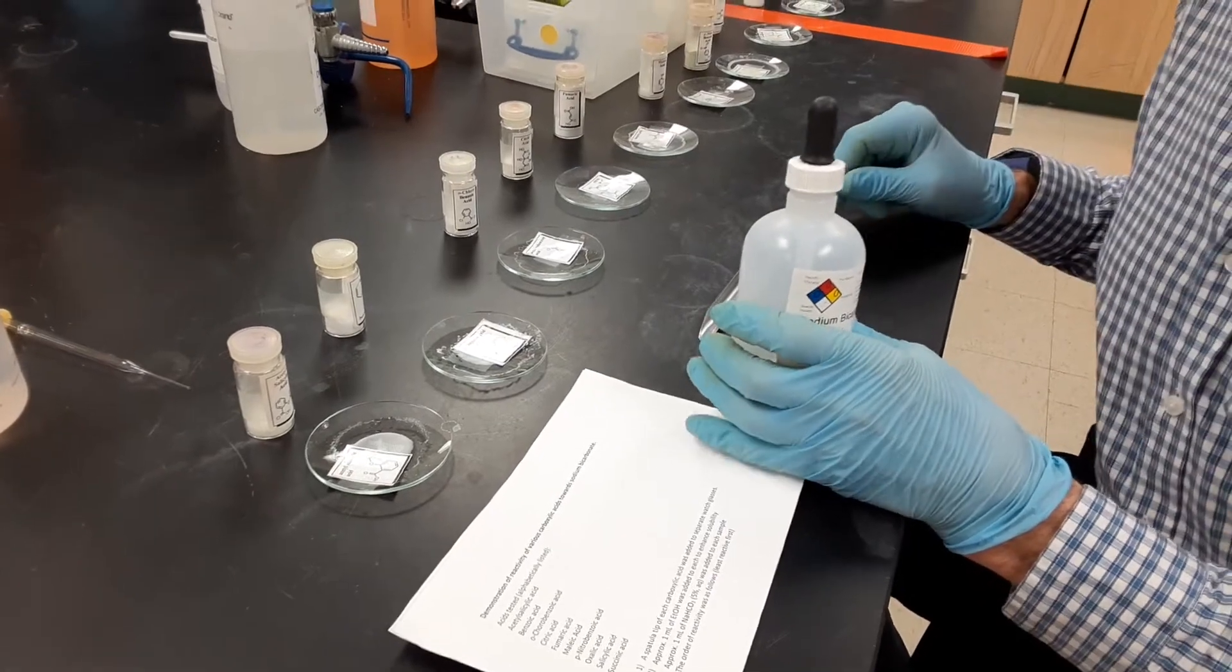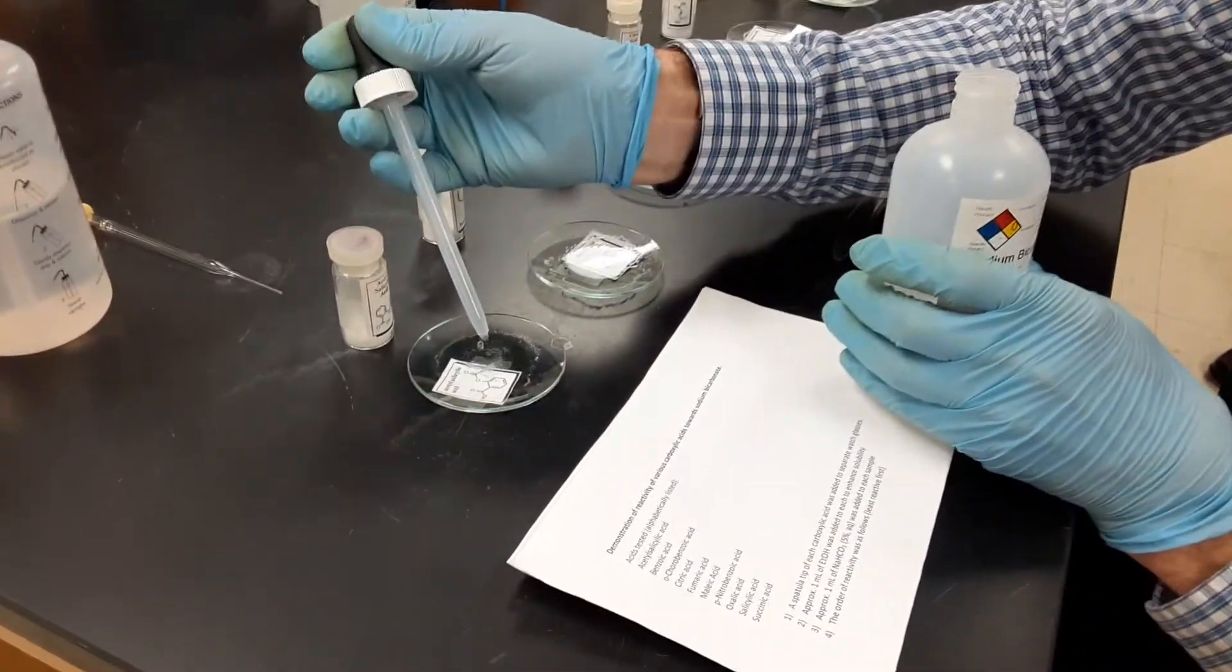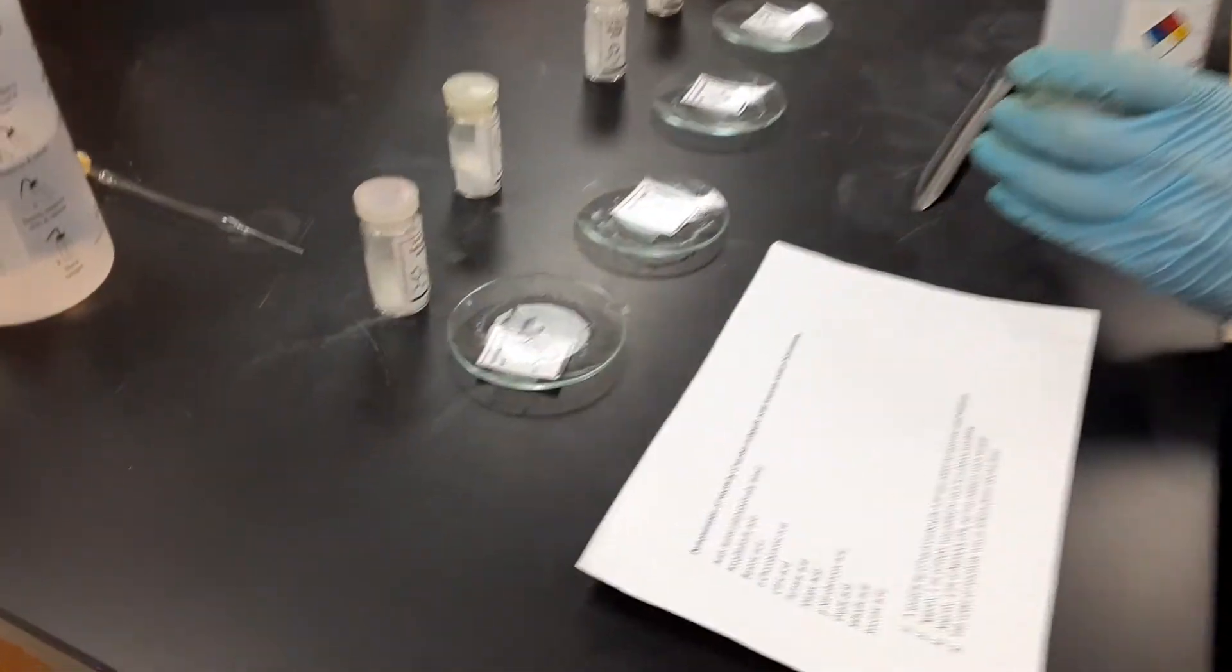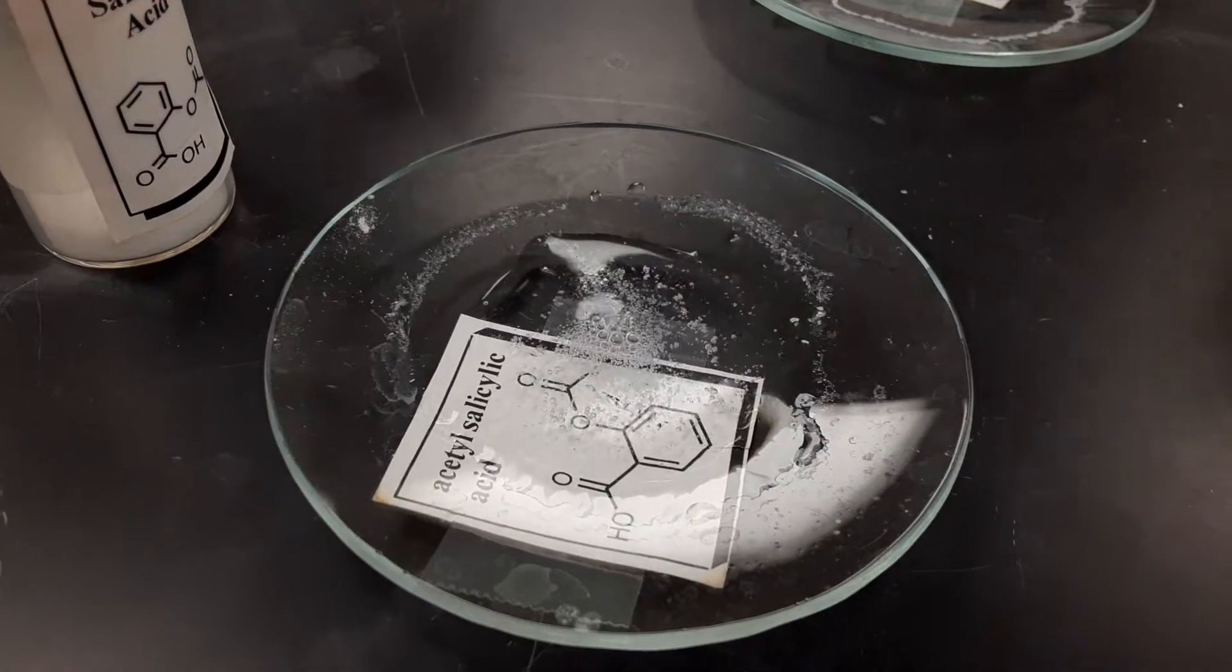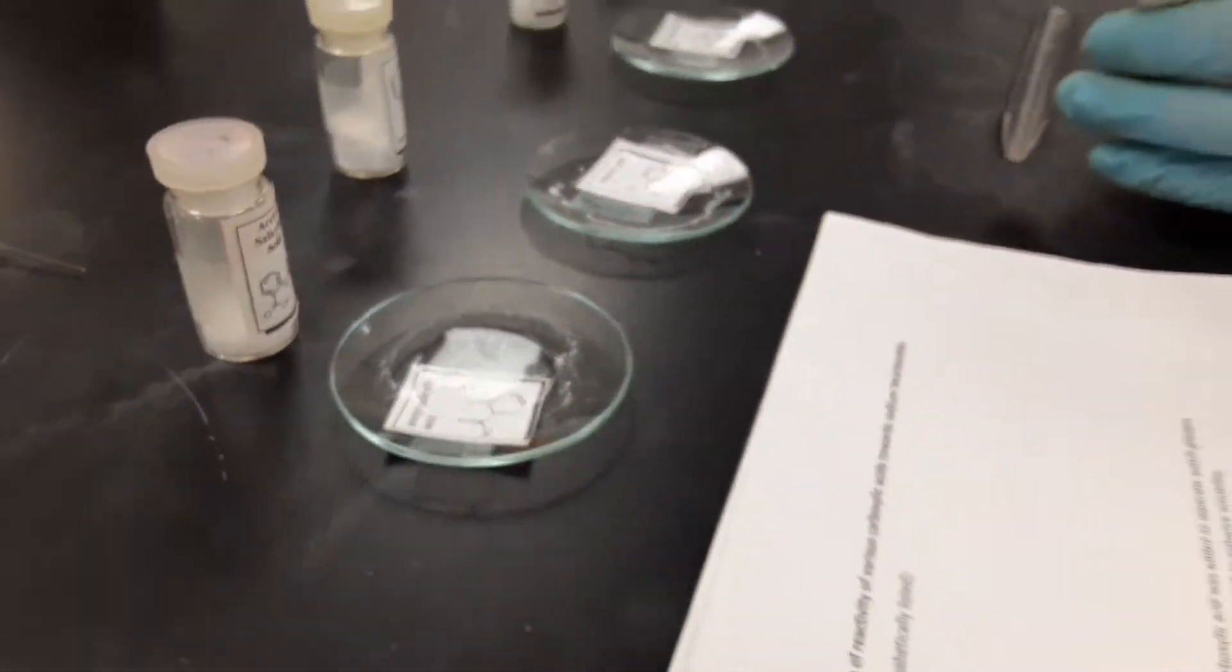So here we go, get right in there. See the bubbles? That's a fairly slow bubble rate. Try the next one, see if it's faster or slower.